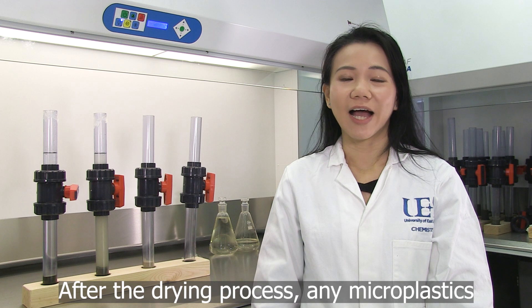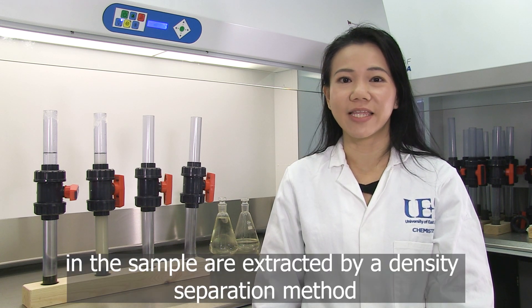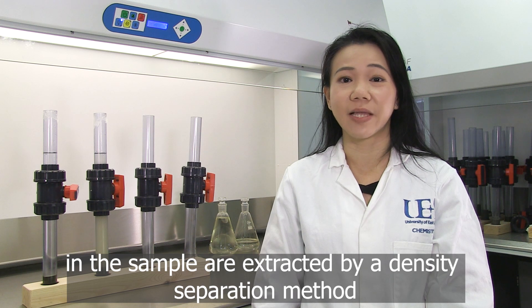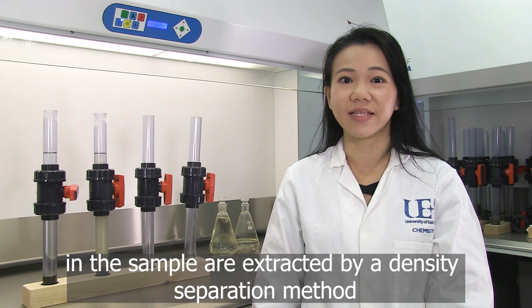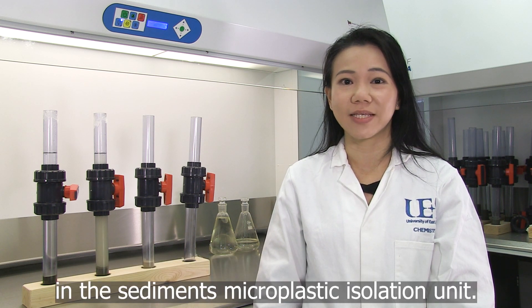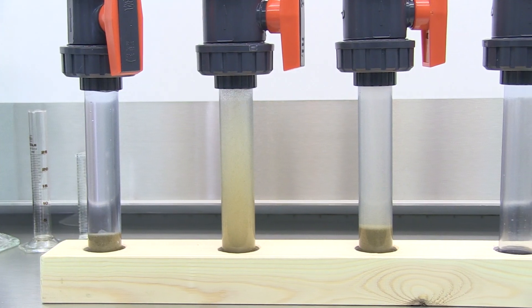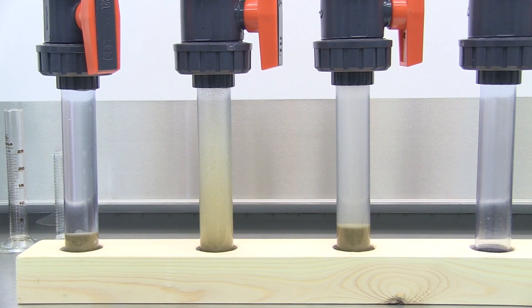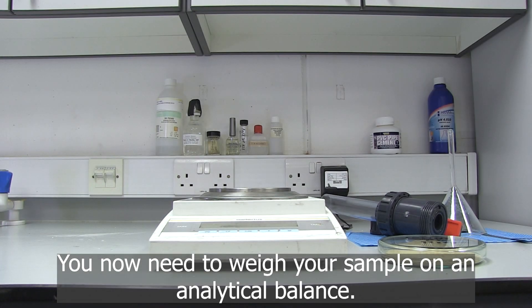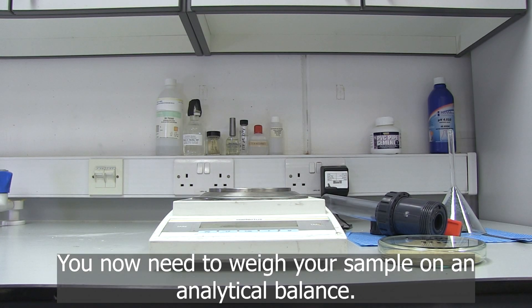After the drying process, any microplastics in the sample are extracted by a density separation method in the sediment microplastic isolation unit. You now need to weigh your sample on an analytical balance.